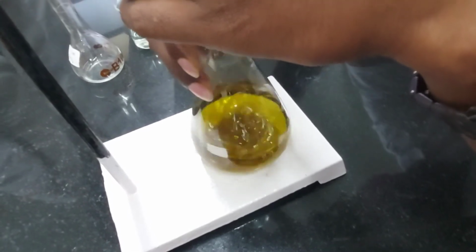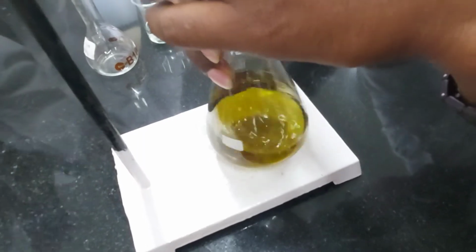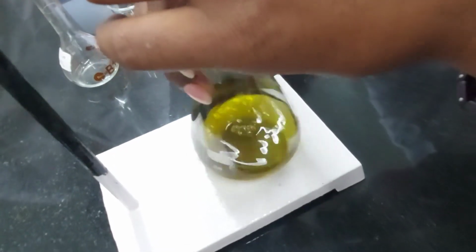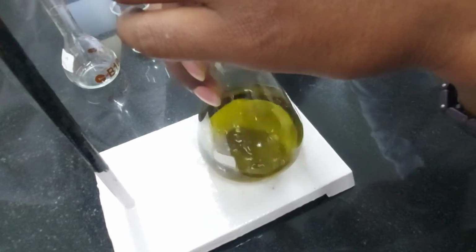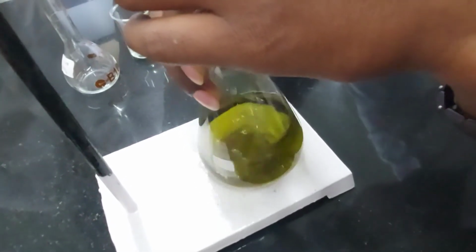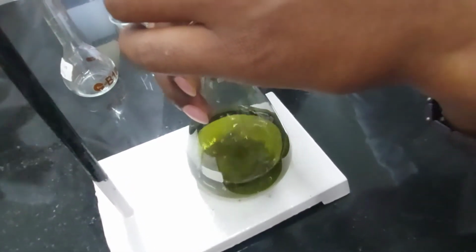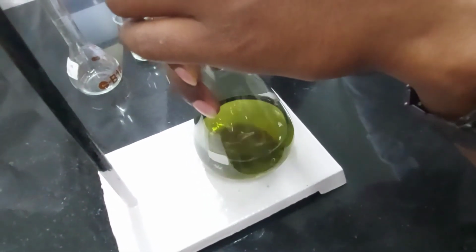Now it is becoming dark green. So it's a slow transition, what you will see, towards the formation of this green color. Keep going. See, it's becoming more and more green. So this is certainly not the end point. We shall see what kind of end point we get.